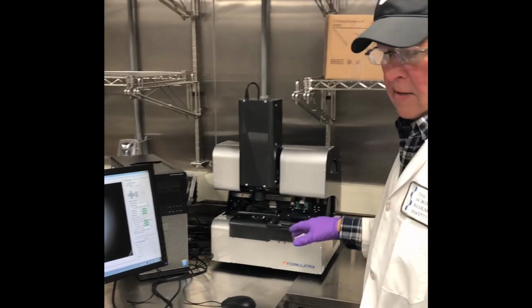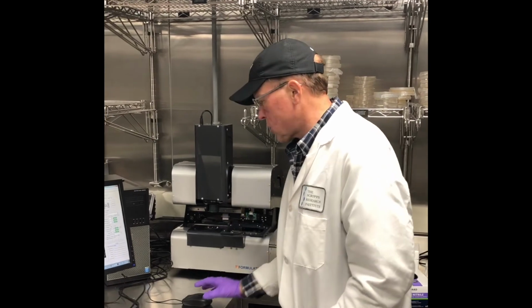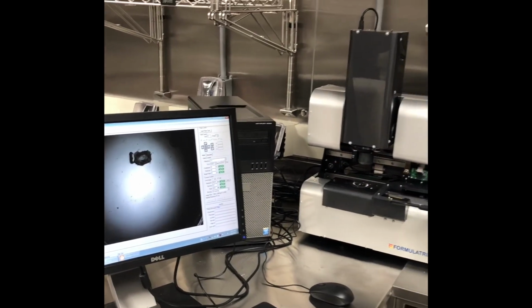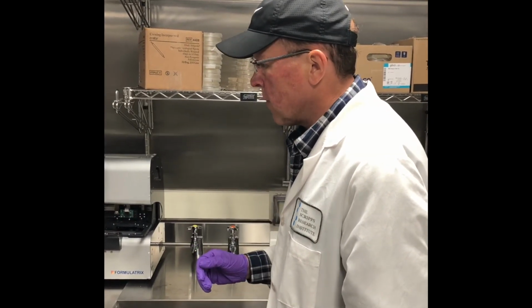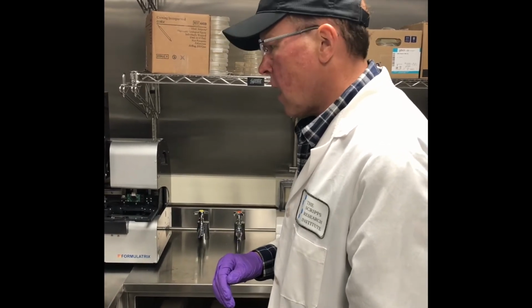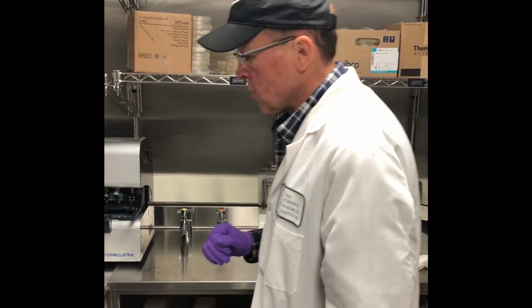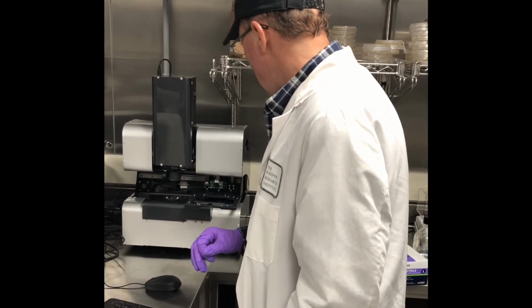Additionally to the instant imaging and the imaging of the barcode, you can use this just as a microscope. The controls are here. It's the same usage as the RI-1000, which I described in that video. Or I can teach you on the RI-1000 and then you can come in here. If you're going to be doing an excessive amount of work with this, you can get remote access to control a computer remotely. Just ask me about that.